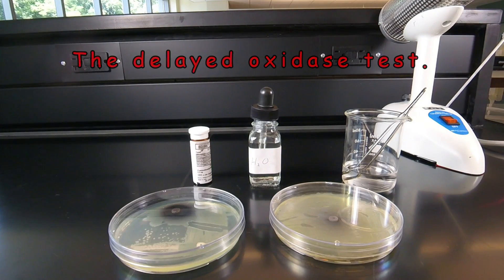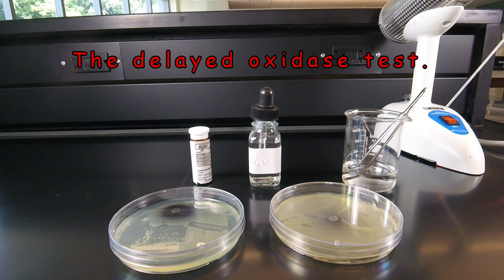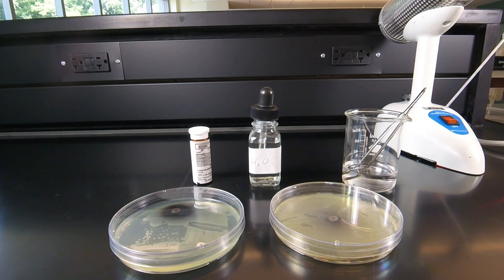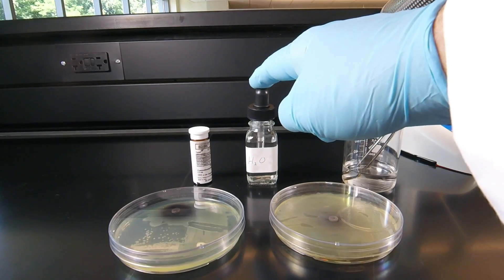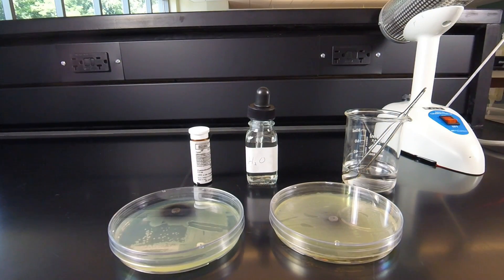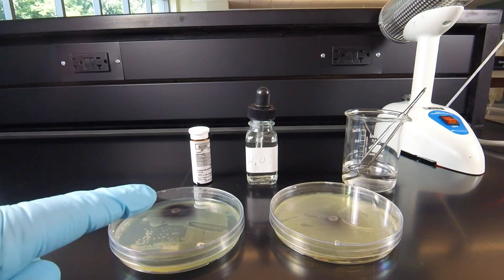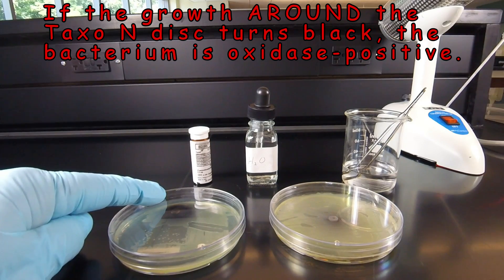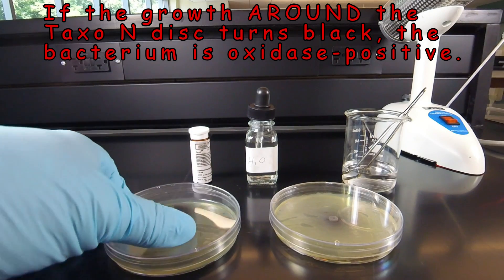An alternate version of the oxidase test done with the Taxo N disc is called the delayed oxidase test, so named because it can take up to half an hour or more to produce a color change, as opposed to the immediate test that gives a color change within 15 seconds. In the delayed test, we again moisten a disc with water, put it on the plate, and let it sit for maybe half an hour to an hour. If the bacterium is oxidase positive, like this Pseudomonas, the growth around the disc turns black — an obvious black halo around the disc.